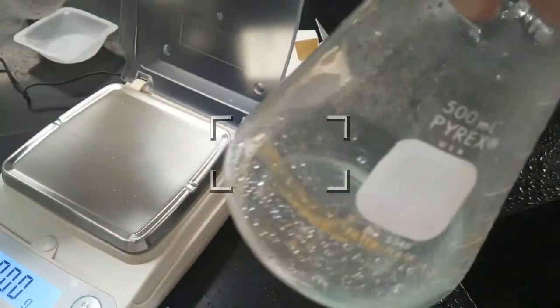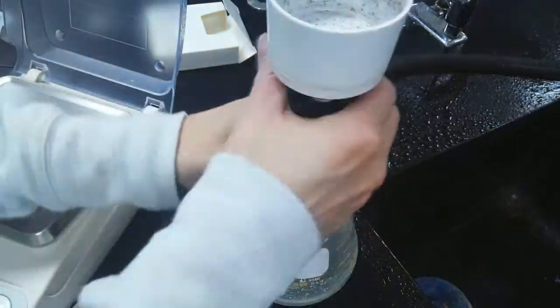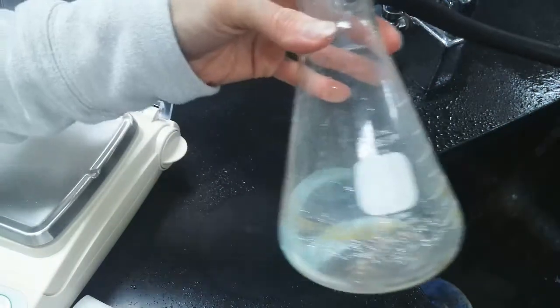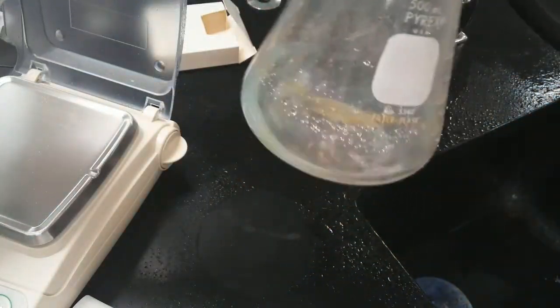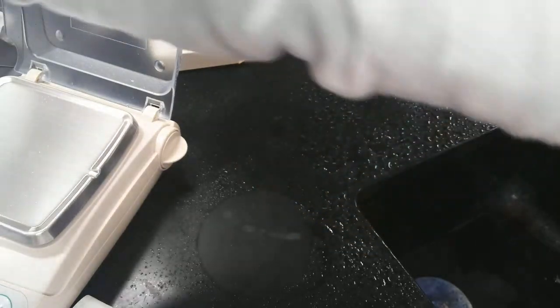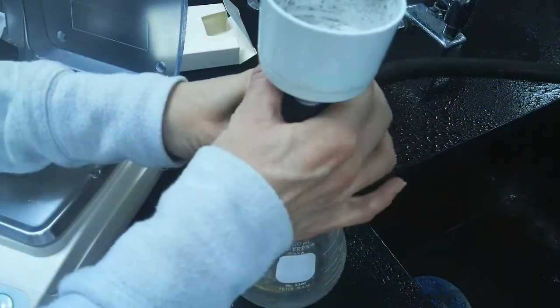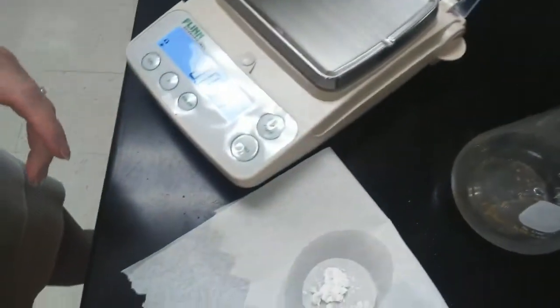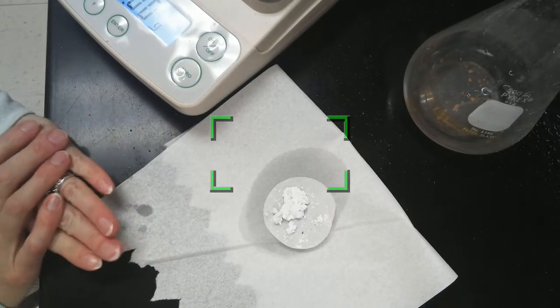They're in the bottom of this flask, which now I'm just going to dump down the drain. I don't want to keep the copper, and I don't want to keep the excess chlorine. I don't want to keep the sodium, and there may be a little excess nitric acid, but that's going down the drain. I'm only keeping the silver chloride precipitate. So this guy goes in the fume hood. We'll let it dry, and then we'll mass it tomorrow.